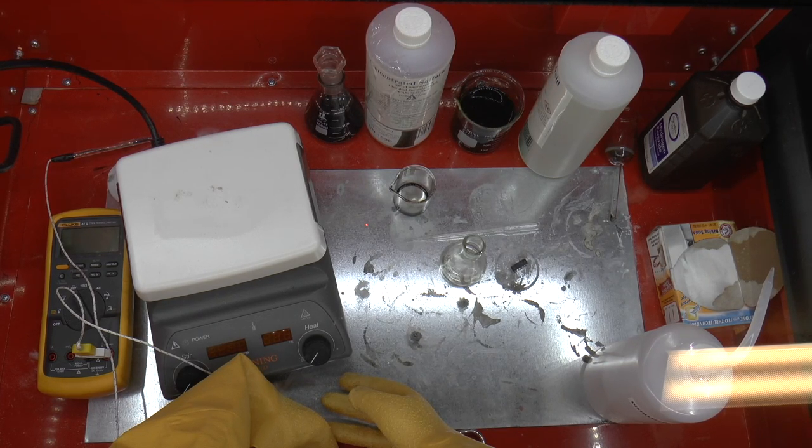Hi, I'm Rob, and this is my chemical fume chamber of horrors.